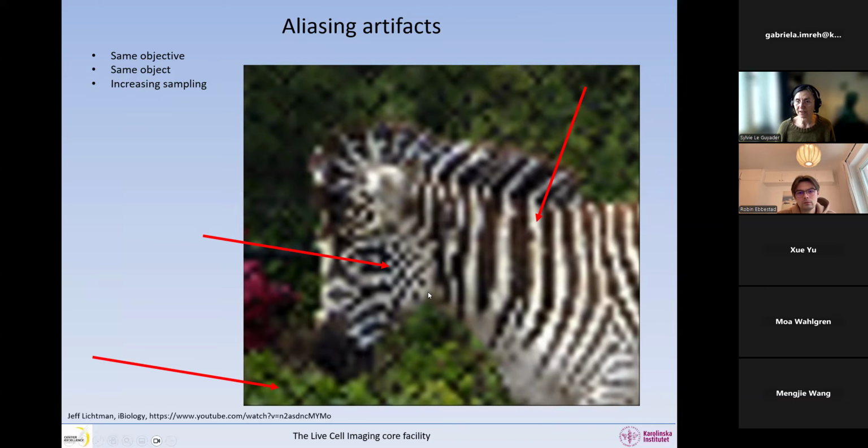Again, this is not something the zebras have. So again, we have things that are created here, bridges between the objects. And if we look here in the background, the poor zebra is not in the jungle or in the desert. So we have all these balls like this in the fence behind.